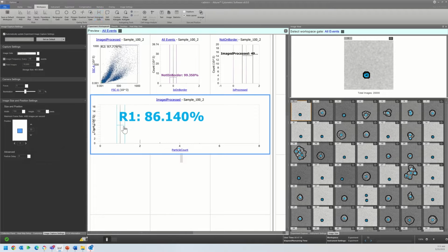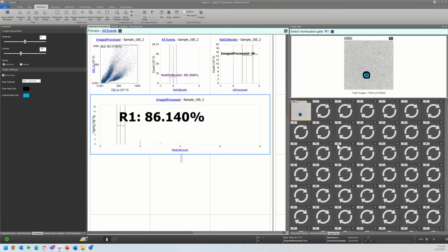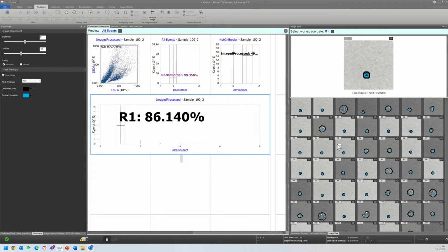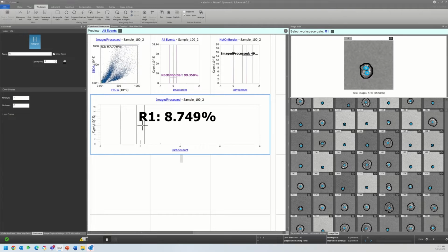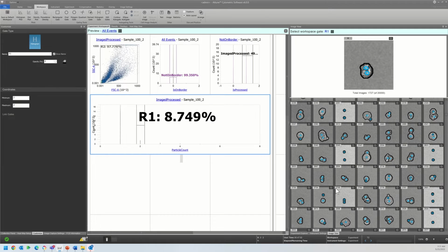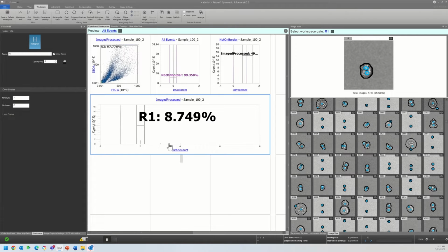If we come in here, this is a very accurate feature and more or less universally applicable to any workflows where you are assessing singlets. In an immunological sample, it is much more accurate than manual gating. And as you can see, these are all the singlets within this gate. This was validated on leukocytes with an error rate within 10%. So this is an extremely accurate tool to use when you are trying to ensure that you're only working with singlet events. So here, the doublets I'm going to exclude for now.